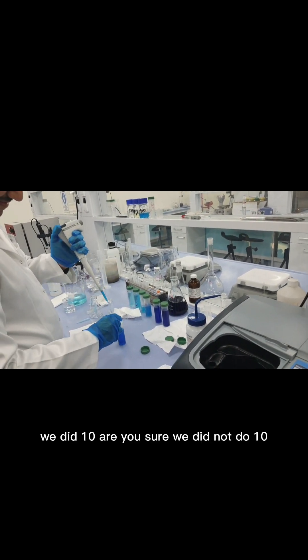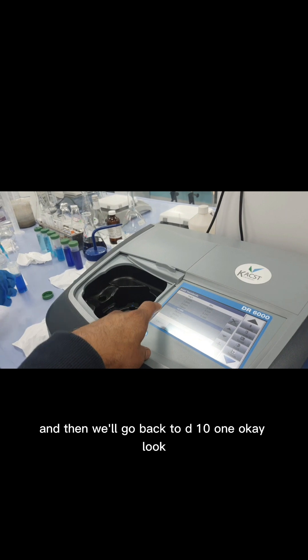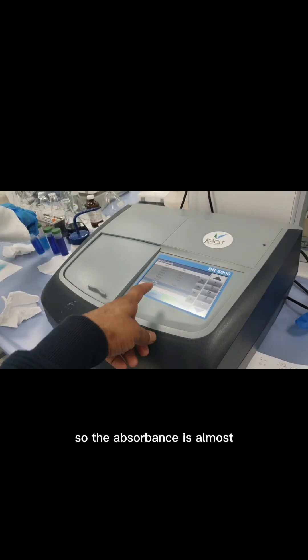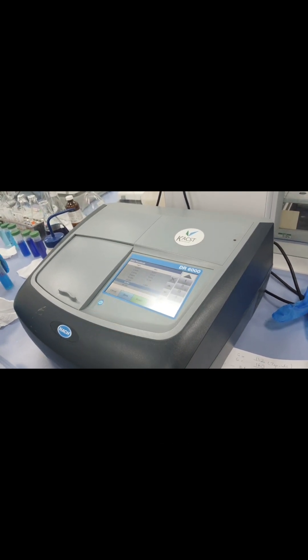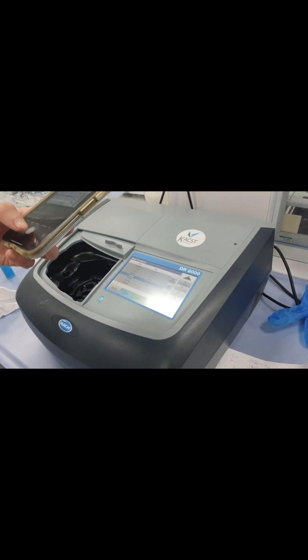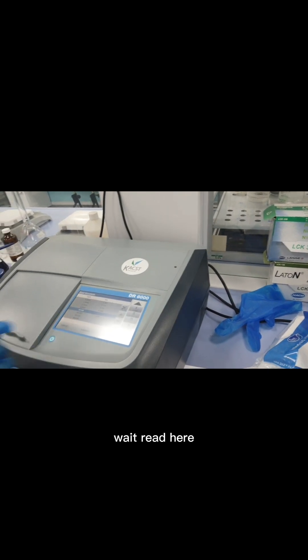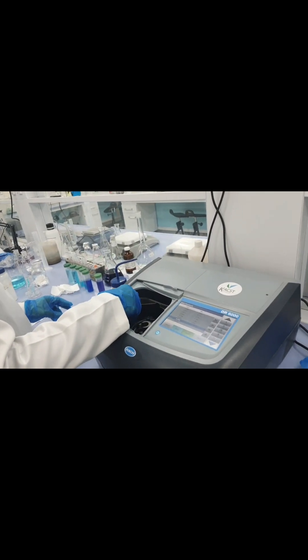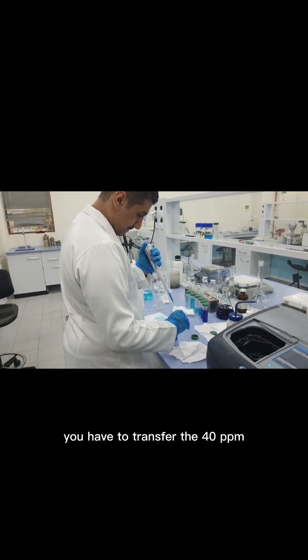Now add the 5 ppm sample — this is around double again. Next, add 10 ppm and press Read. We will first read the 20 ppm and then go back to the 10 ppm one. For 20 ppm, the absorbance is around 0.5, and the 10 ppm reading is approximately half of that, confirming the linear relationship.